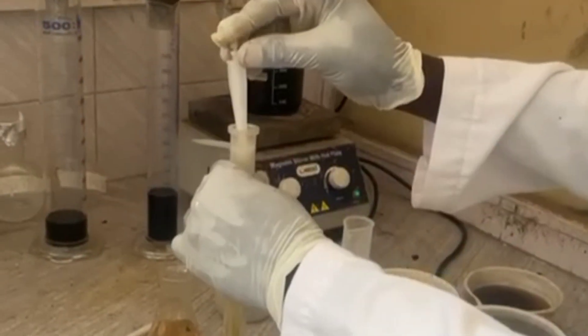After grinding, we move to acid leaching. In this case we are using an acid, and from research, hydrochloric acid appears to be one of the most effective acids for this purpose. We prepare our acid solution at a specific concentration — research shows the range is from 1 molar to 4 molar, but for efficiency we are using 1 molar.